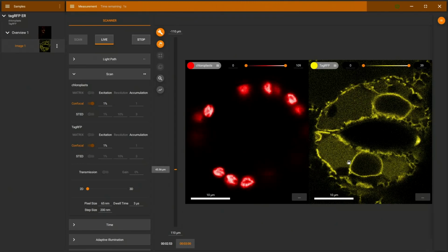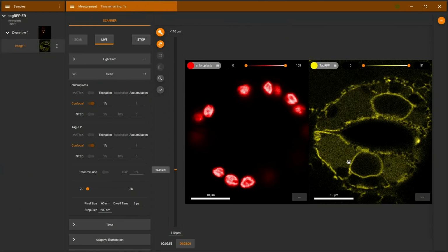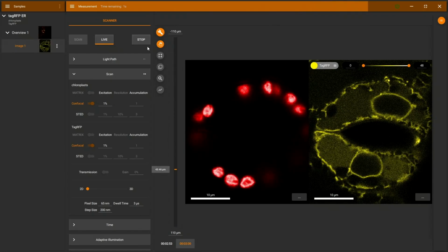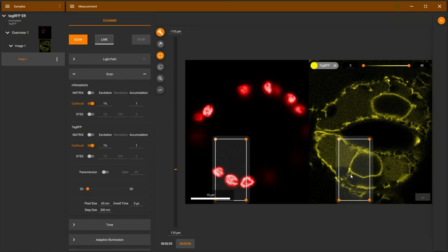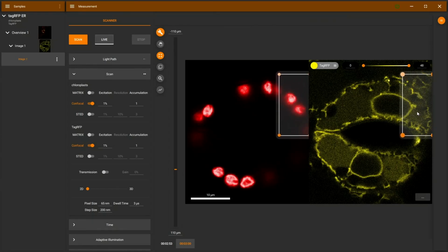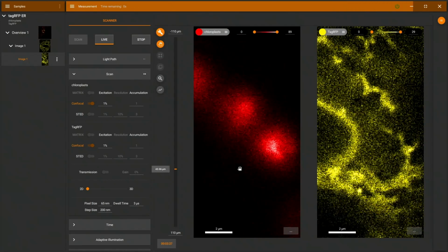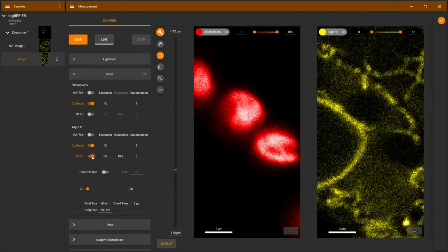And you can see the ER structures are quite complex here in the stoma, with gaps where the chloroplasts are sitting. I will now select an area where there's chloroplasts and ER structures. And then I will change the settings for STED imaging. Here you can see chloroplasts, bring them into focus a little bit more. And now I'll switch on STED, get a little bit more excitation power, and maybe 15% STED laser power.